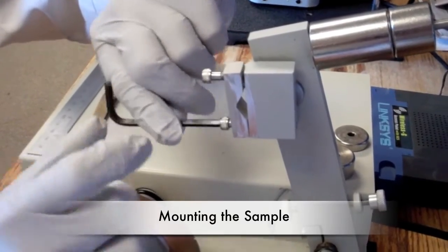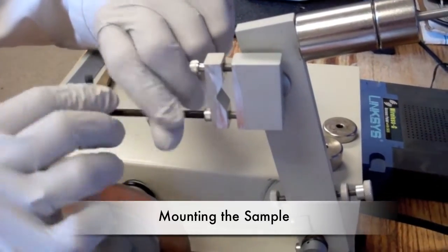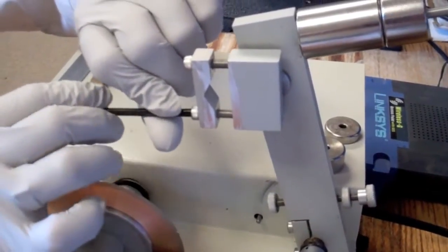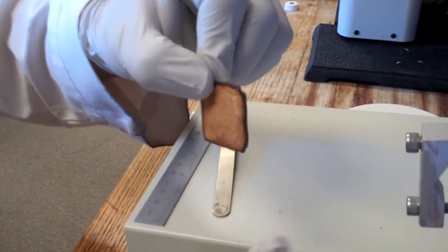Next we will mount the sample. The gate is controlled by two bolts and can be unscrewed using an Allen wrench. The sample size is limited by the lengths of these screws.